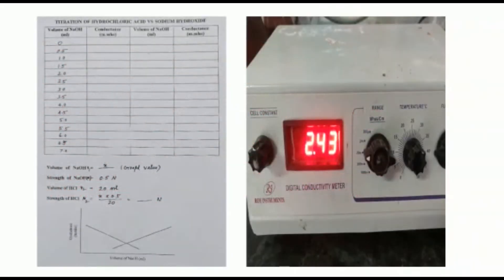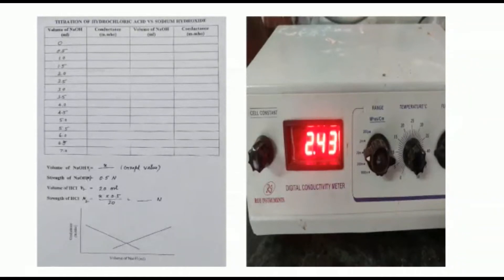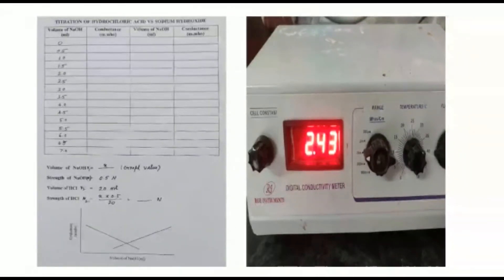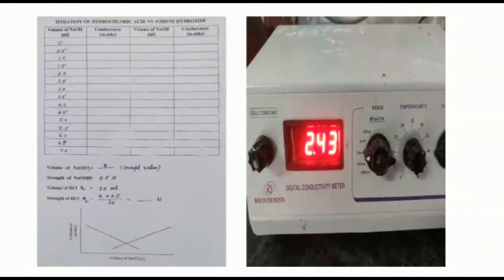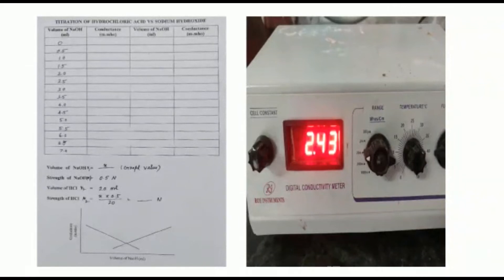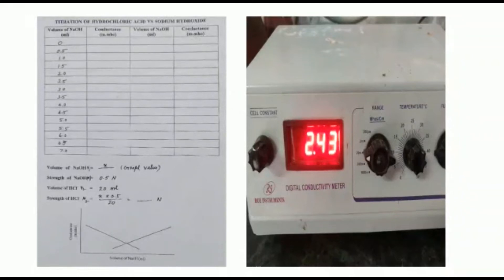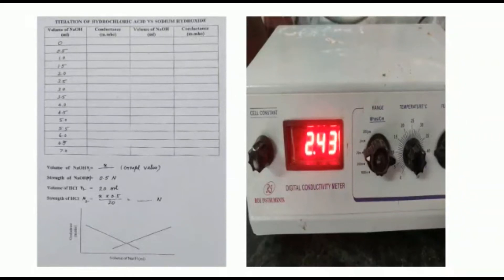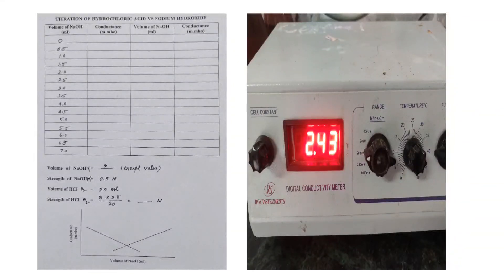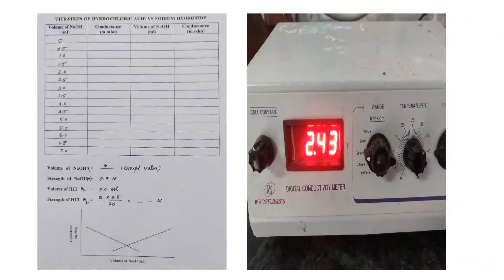From the graph, we can calculate the volume of sodium hydroxide used for the complete neutralization of hydrochloric acid. The graph is drawn between conductance and volume of sodium hydroxide. At the equivalence point, only NaCl and water are present, giving the least conductance value on the graph. After the equivalence point, excess sodium hydroxide is added, and the accumulation of OH⁻ ions, which have high ionic conductivity, causes the conductance to increase.